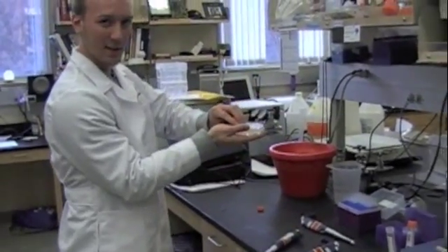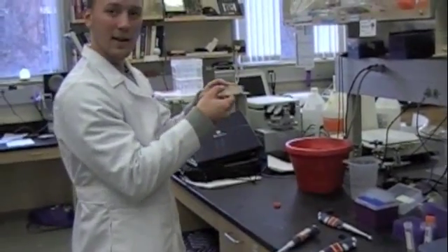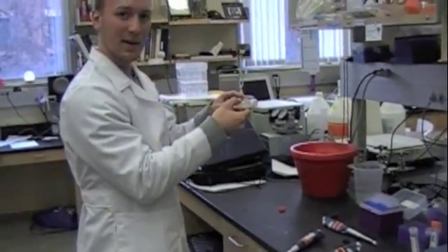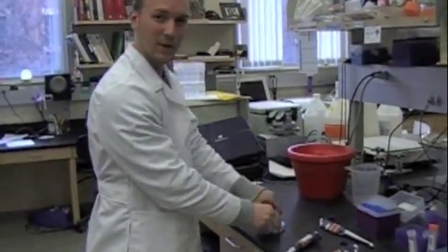Simply take your agar plate now, once it's dried, put it in a 37 degree Celsius incubator and incubate overnight. In the morning come back and check for transformants.